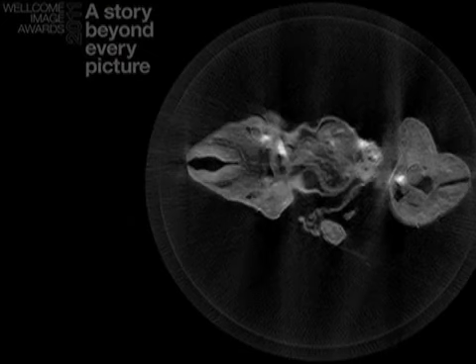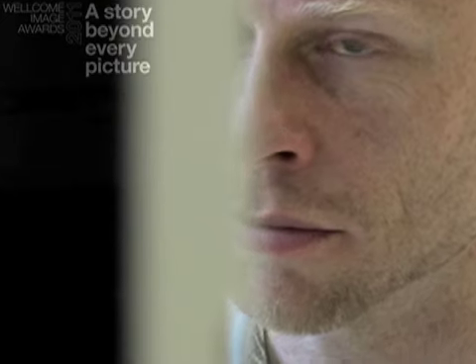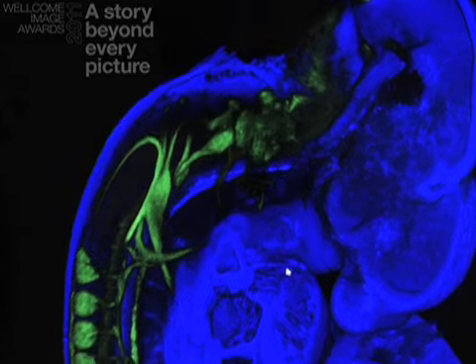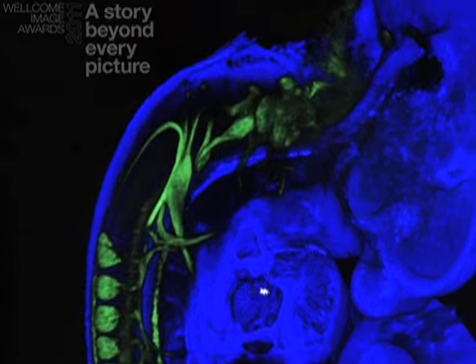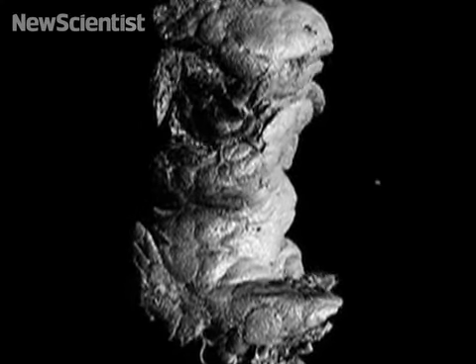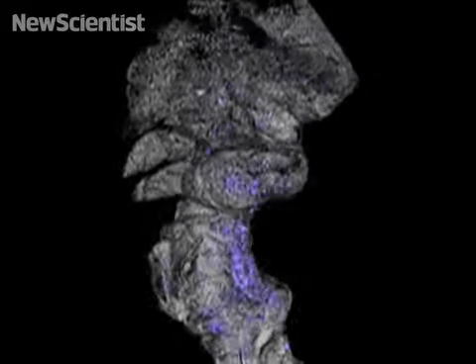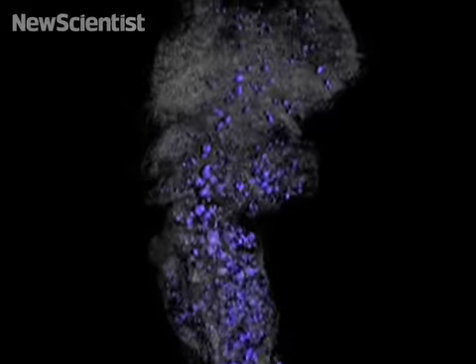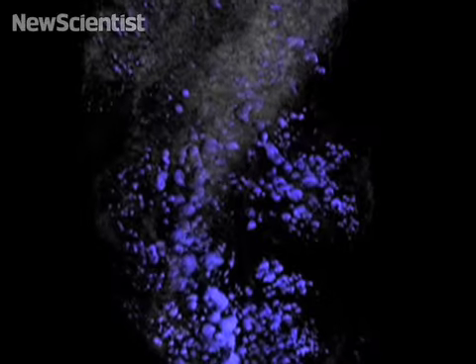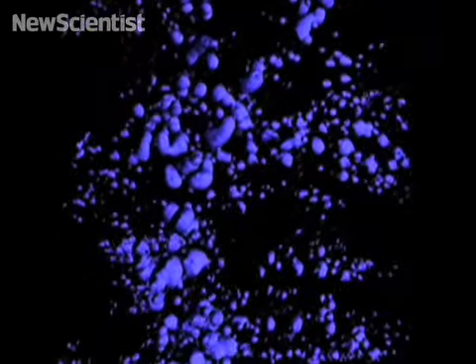400 images of the sample were taken and then put back together to create a 3D effect. The technique was used to study how diabetes progresses, and it's also being used to show how different genes affect an embryo's development.